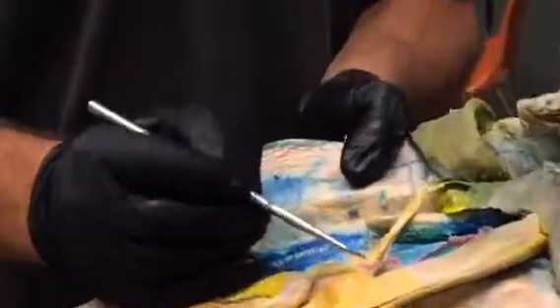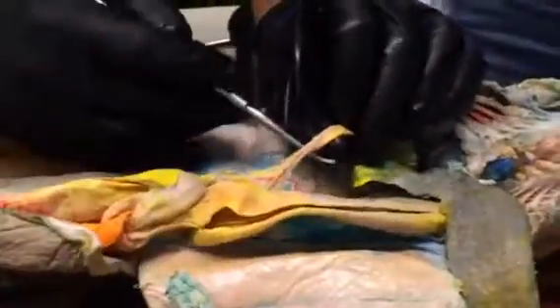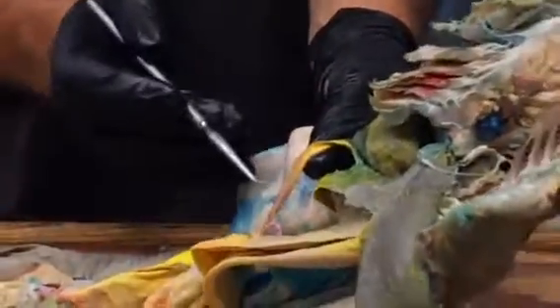There's also a gastrohepatic artery that comes off of the celiac, and that one gives rise to branches that run out to the stomach, which would be the gastric part, and a hepatic branch that runs through the lesser omentum here to the liver. And that's supplying oxygenated blood to the liver, because the liver needs to get oxygenated blood as well as the nutrient-rich blood coming back from the gut.